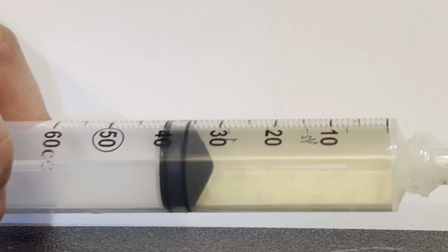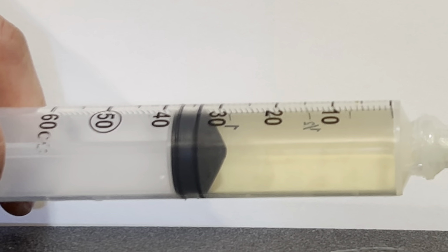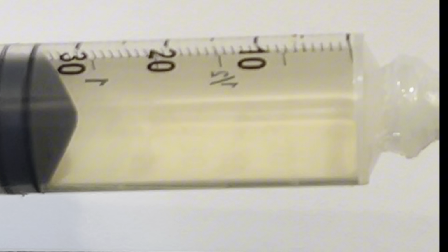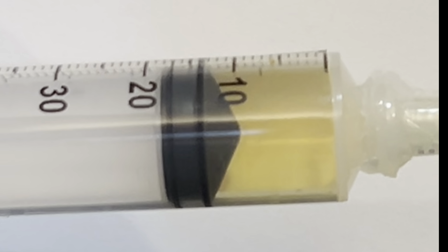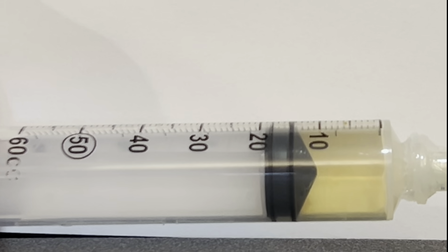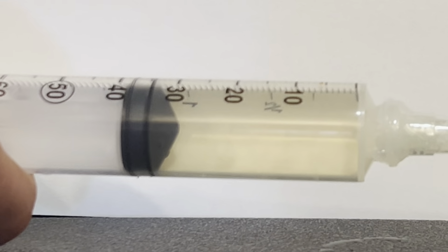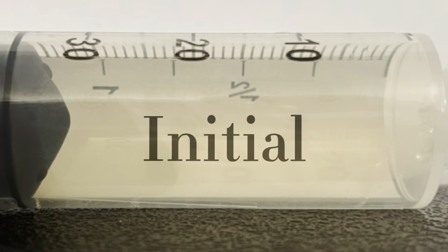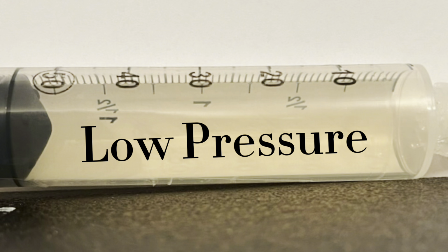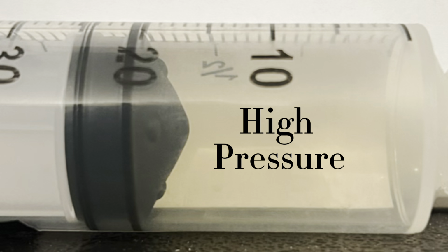I have here a sealed syringe filled with about 40 milliliters of the same equilibrium mixture as before. When I suddenly increase the pressure, it gets darker, but then gradually begins to lighten again. That initial counterintuitive change in color is due to the temperature increasing from compressional heating. But after letting it sit for a minute and come back to room temperature, you can see that the gas gets ever so slightly darker at low pressure and ever so slightly lighter at high pressure.